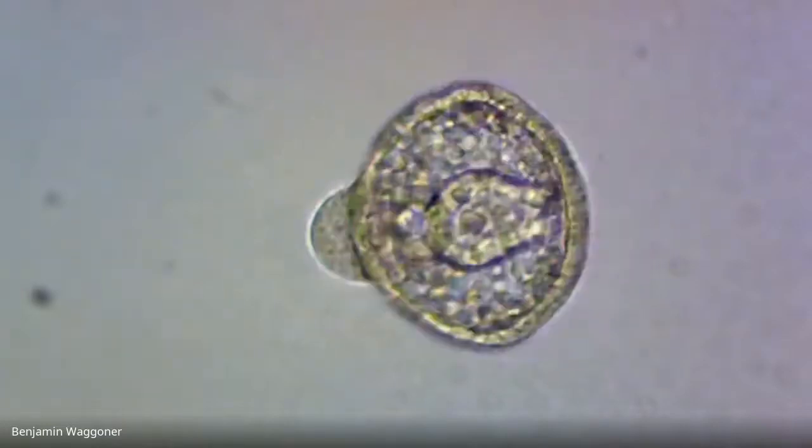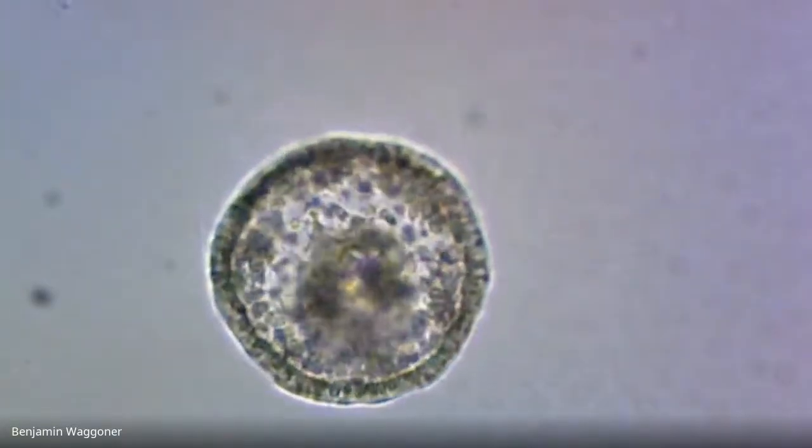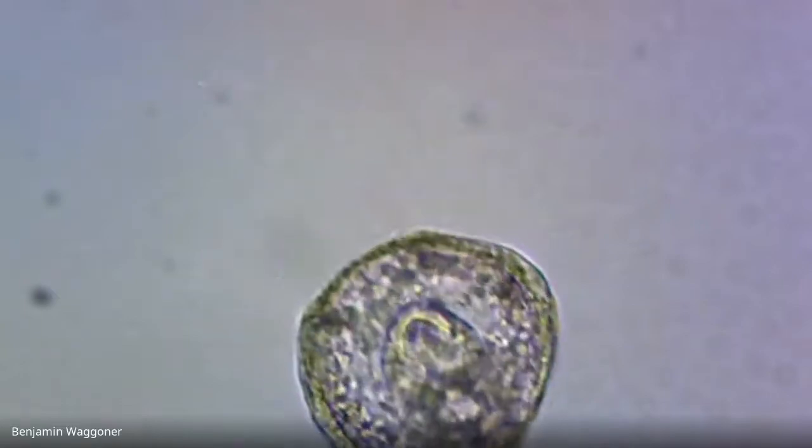But I think you saw the complete gut. And there it is again. That's the same guy. Yeah, and now he's kind of turned around. Yeah, but that's the anal end. All right, it's a prism larva. I'm going to quit chasing it.